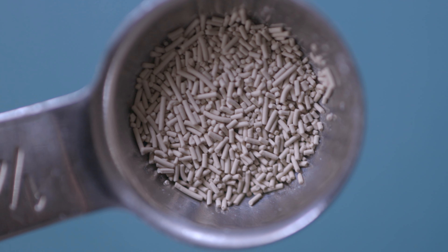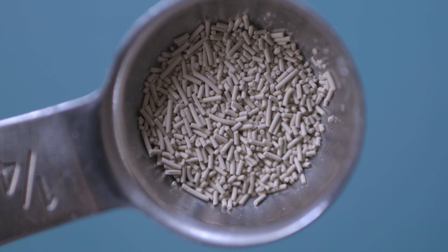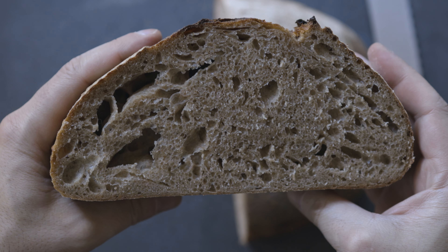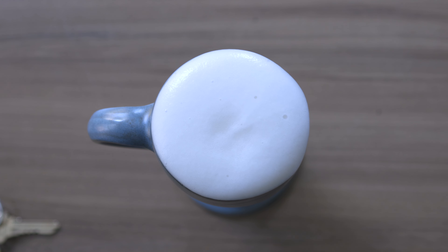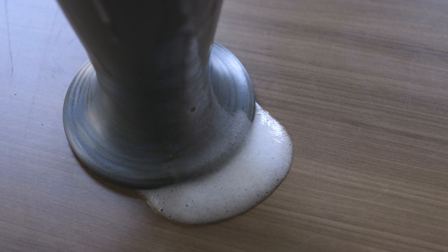We have a 14,000 years old relationship with this tiny organism. It makes our bread fluffier and beer bubblier by releasing carbon dioxide and ethanol. It is a master of fermentation.